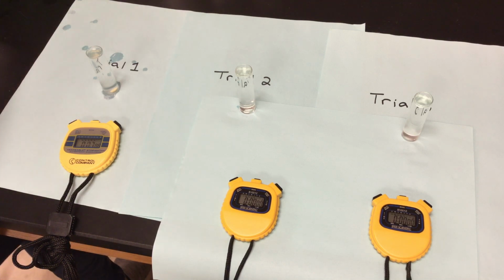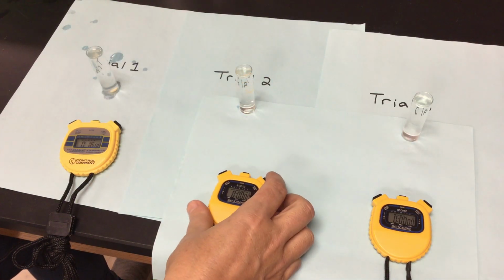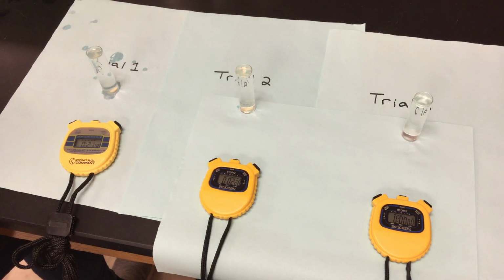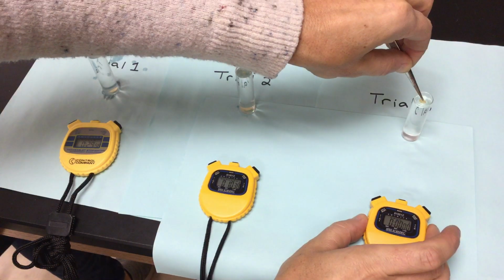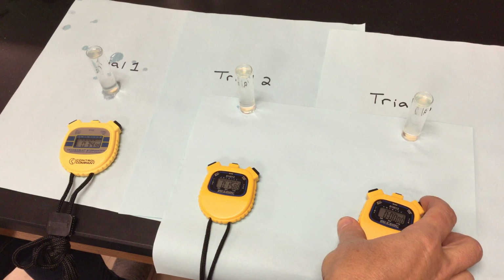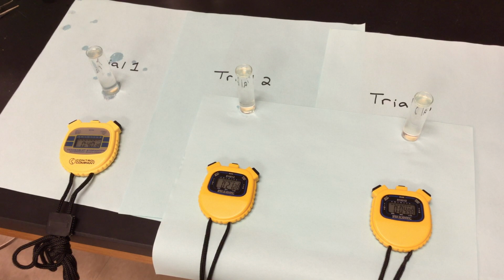My second one. And now we're doing all 3 trials. Start the timer when it hits the bottom. Third one. Same thing, pH of 11. We're just getting our averages because there are many factors that may change here. So the amount of yeast that's on those particular filter papers, so I had 2 stuck together, things like that can affect it. So I'm letting that time go, giving my little yeast guys some more warm water so they can be happy. They tend to thrive better in warmth.